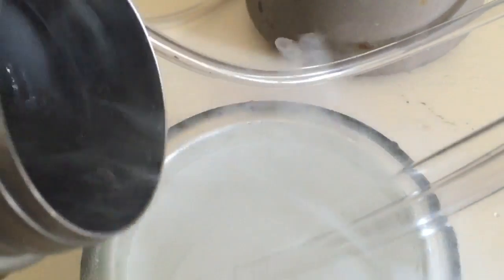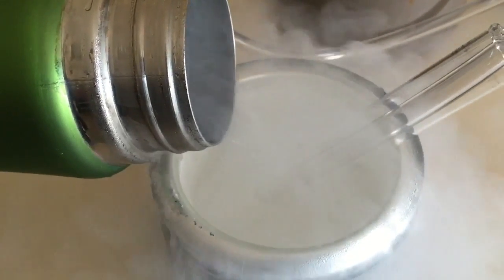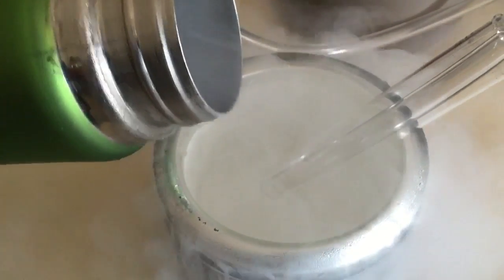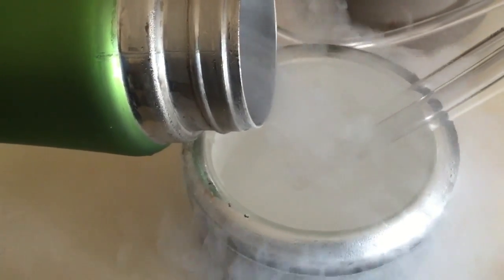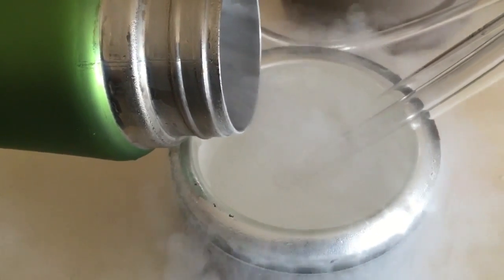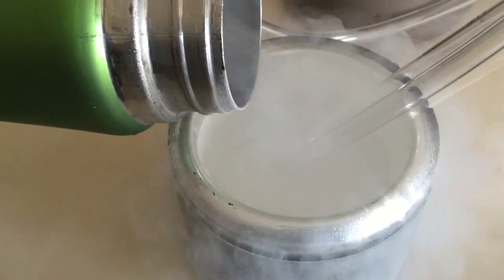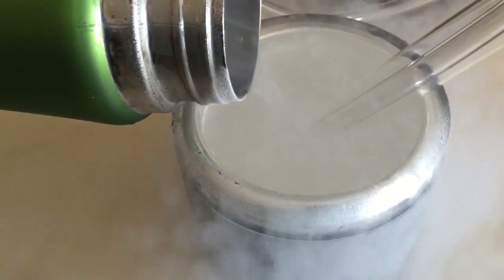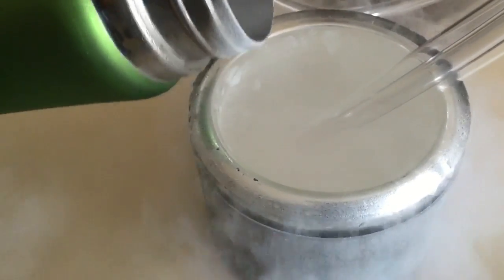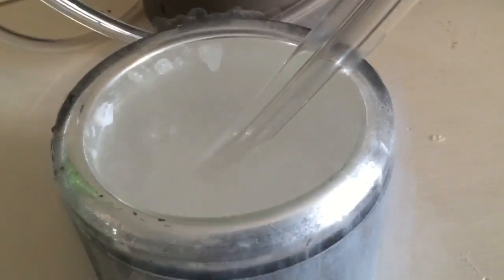This is a repeat experiment. When you try to liquefy argon, make sure that the test tube you plan to liquefy it in is completely purged of air, because the water vapor and carbon dioxide in the air will condense out. I've got a positive pressure of argon flowing through that tube. Make sure you've got gloves on because this stuff can burn you if you get it on you. I'm going to get this dewar vessel pretty full.